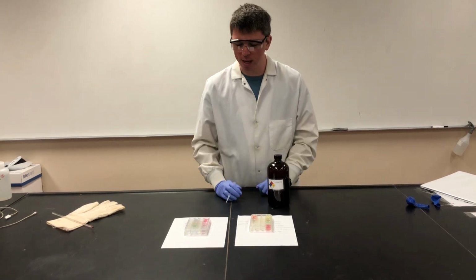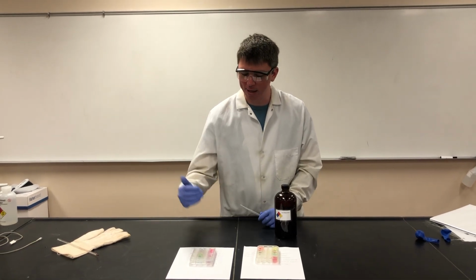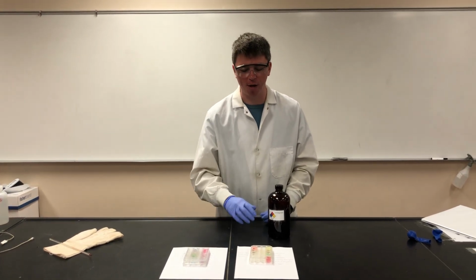So what we'll do is we'll make sure that all of these pictures get uploaded for you, and you can go through and name each of these colors and try and compare them to figure out the exact pH number of each of these household items.